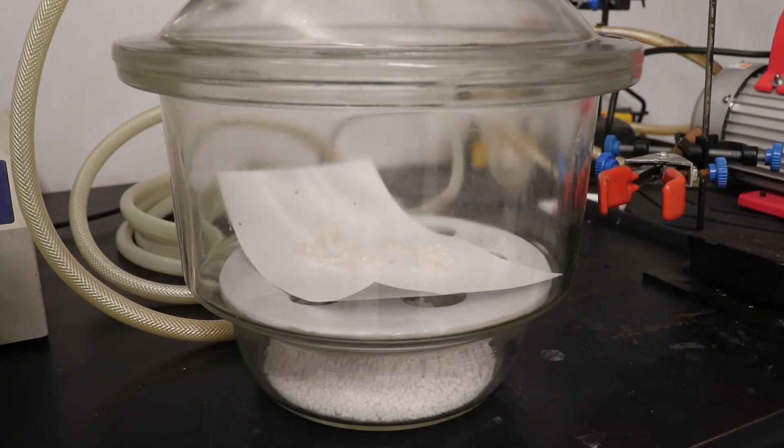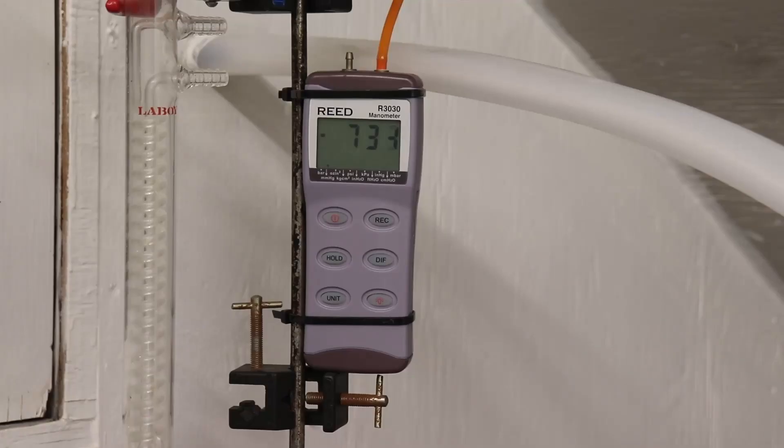I dried the product overnight in a vacuum desiccator over calcium chloride, but this step is unnecessary, and air drying is sufficient.